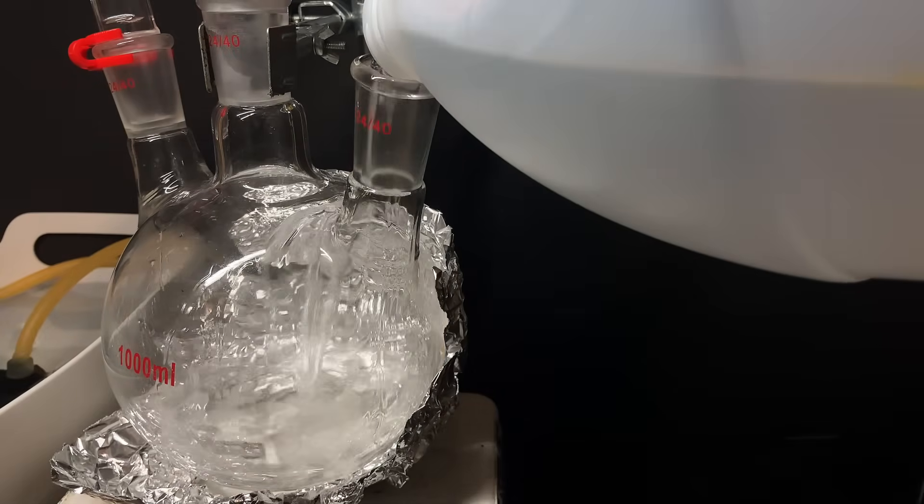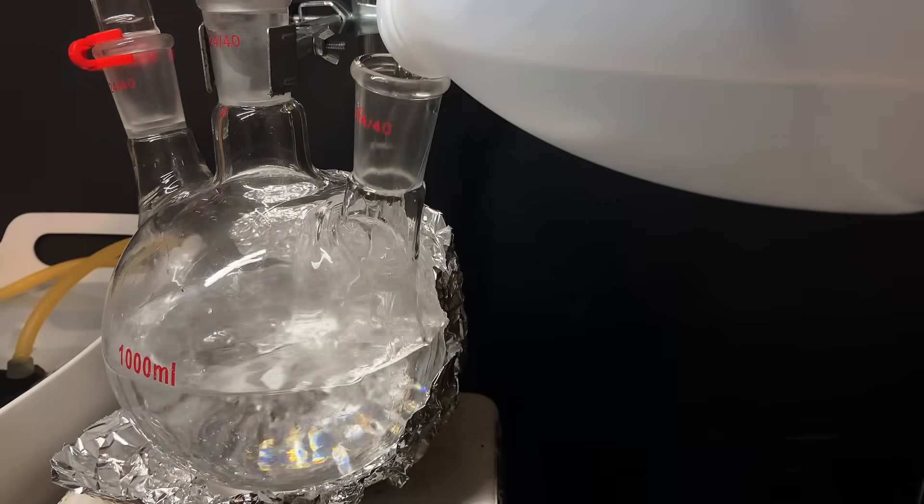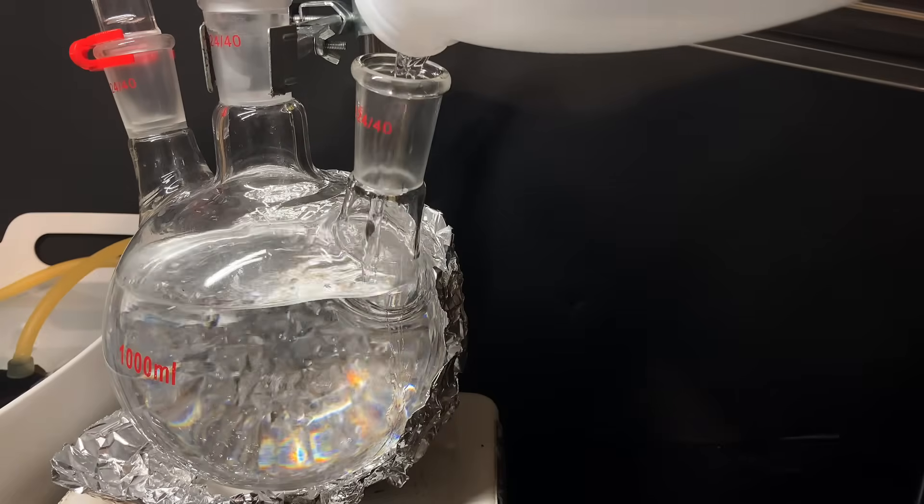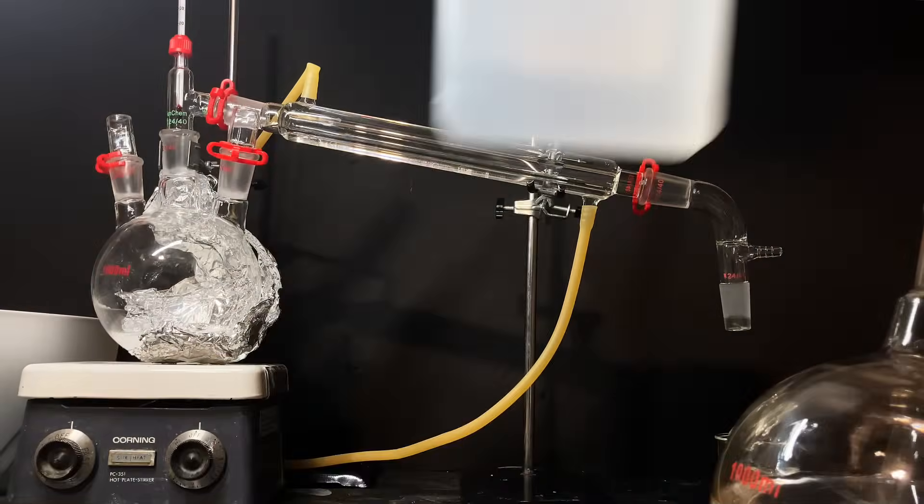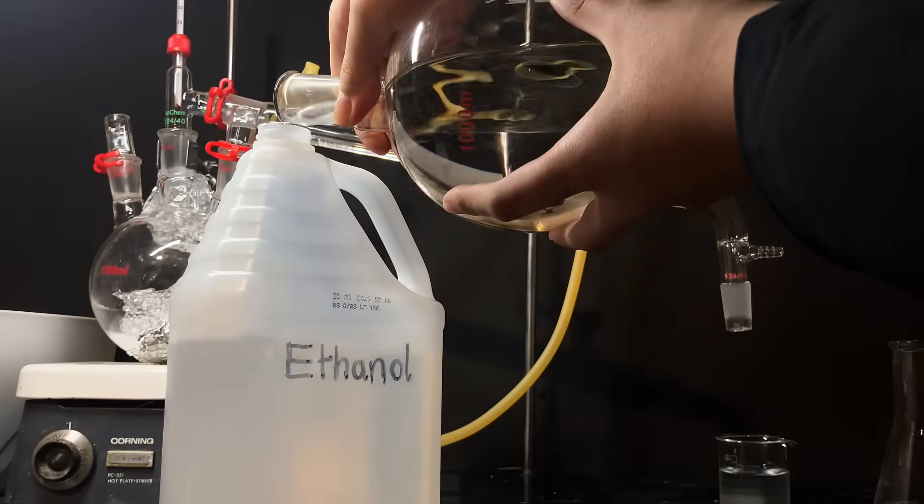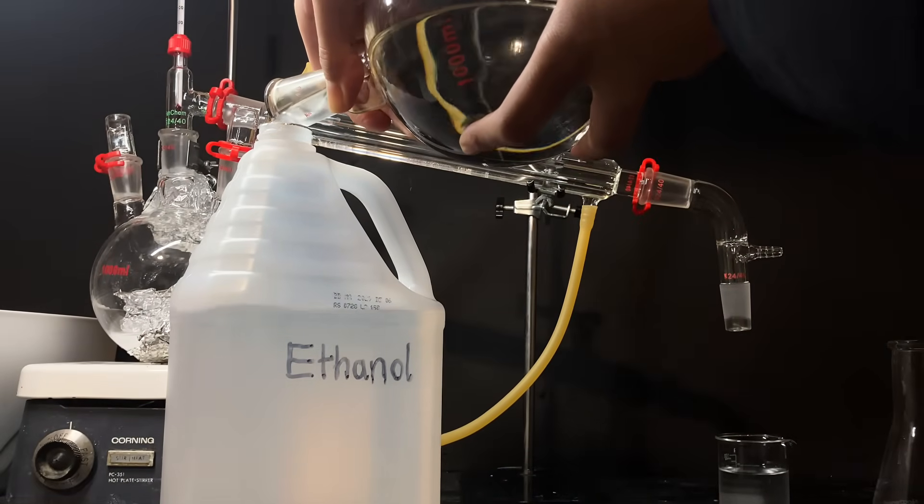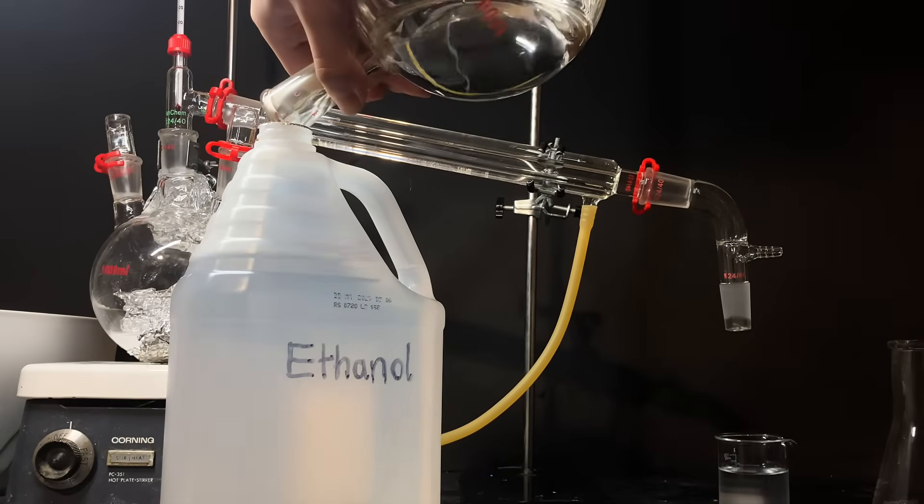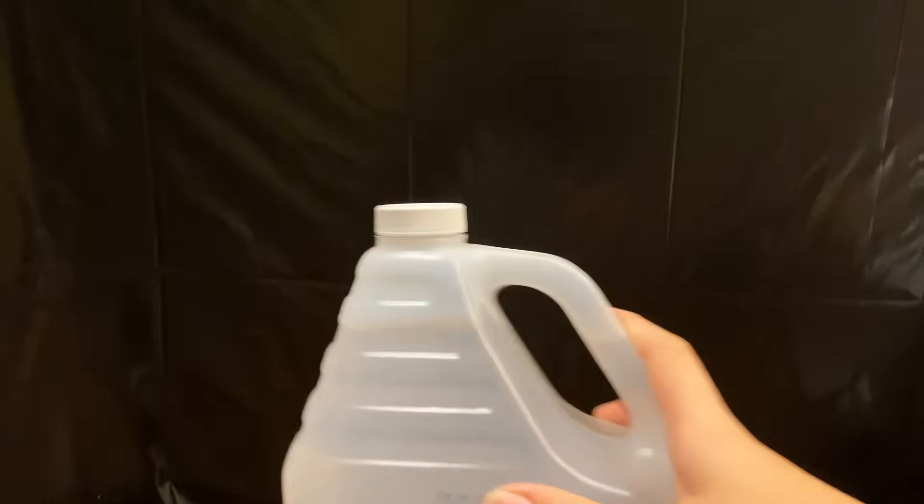Also, in hindsight, I maybe could have used a water bath, but I didn't want to bother replacing water every hour. Anyways, now that I had a huge amount of 95% aqueous ethanol, it's time to get rid of that last 5% water, through a massive drying step as I mentioned using molecular sieves.